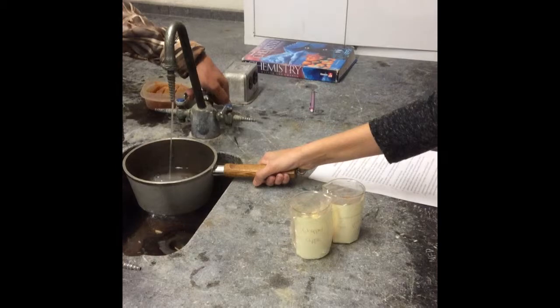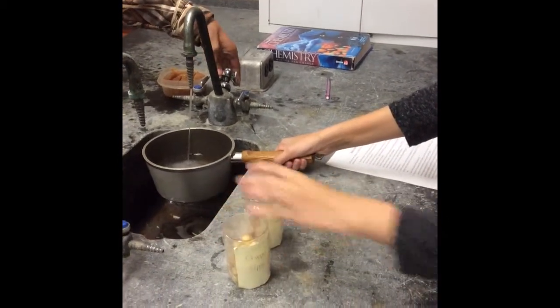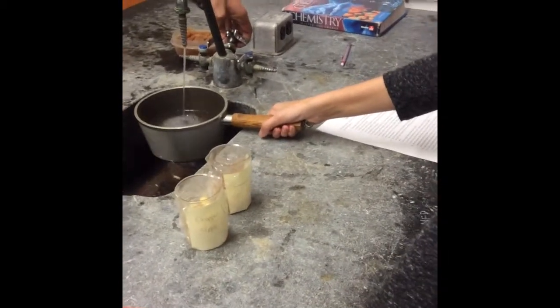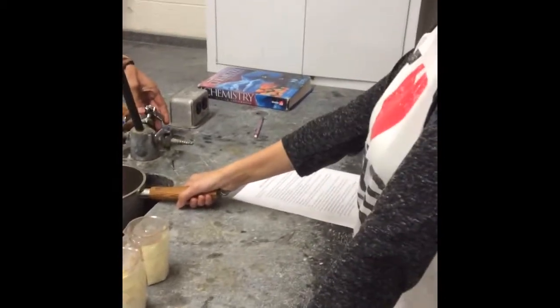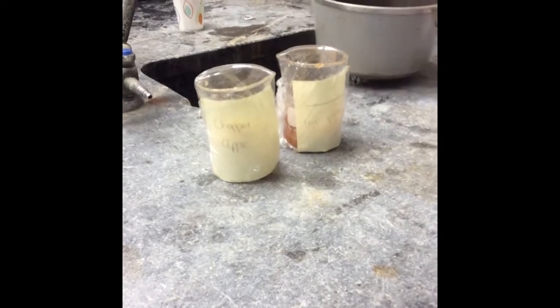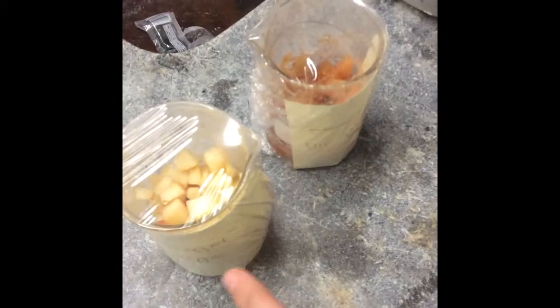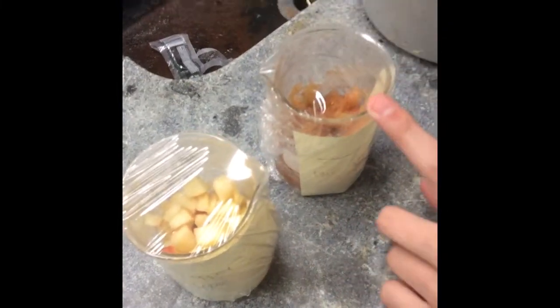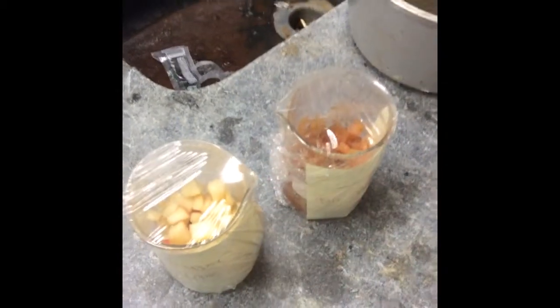What are we doing now? We're filling up the pot so we can set our chopped apple and apple puree in a water bath. In a water bath. Okay, and what's the temperature of the water bath going to be? 40 degrees Celsius. Okay, and for how long? For 25 to 30 minutes. Okay. And we have labeled beakers covered in saran wrap. And what's already inside both of these products? We have chopped apples from the store, and we have our apple puree from when we first did these. And what's in both of these? Pectinase. 4 milliliters of pectinase. Okay, very good.